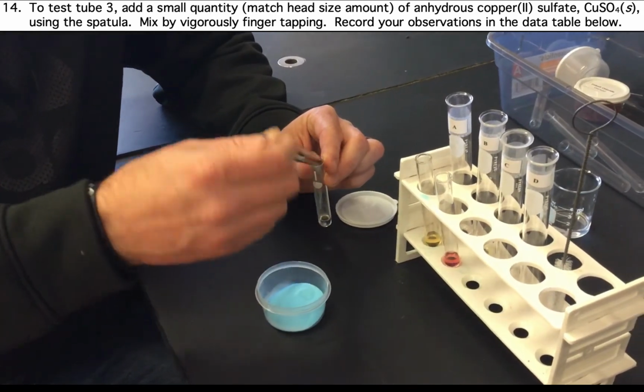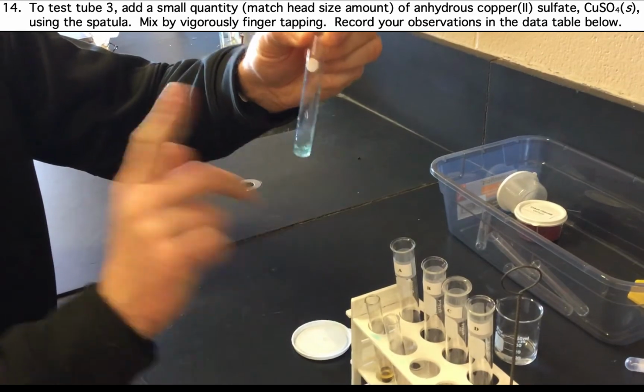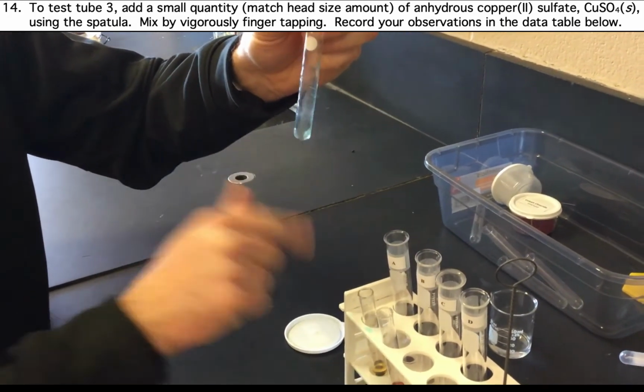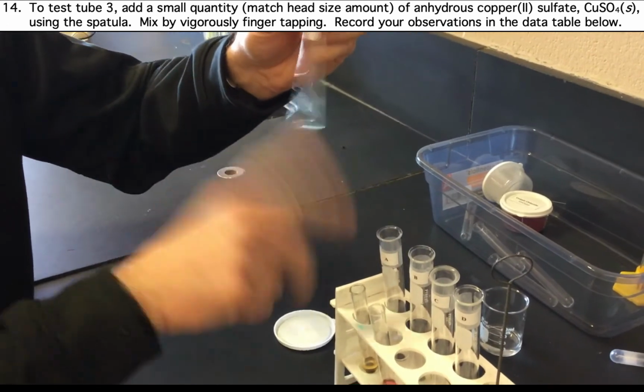The final test we will do on the distillate is a test with copper sulfate. Finger tap, make observations, and record these observations in the data table on page 2.